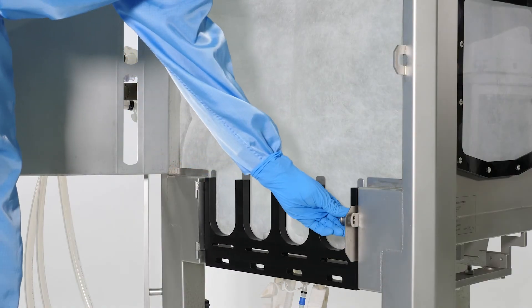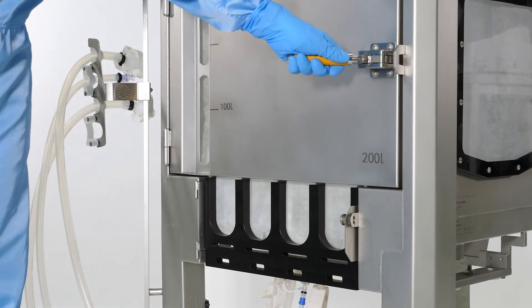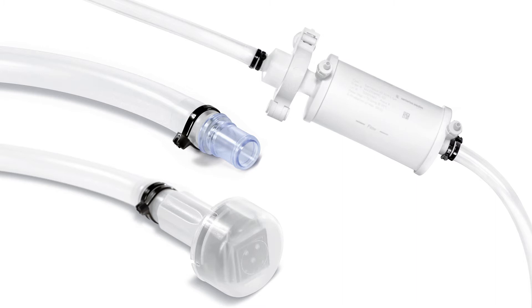Close the pallet tank port gate and door. If the bag assembly design has sterile connections using membranes, filters, or open ends, ensure the tube clamps are closed. Otherwise, clamps can remain open.